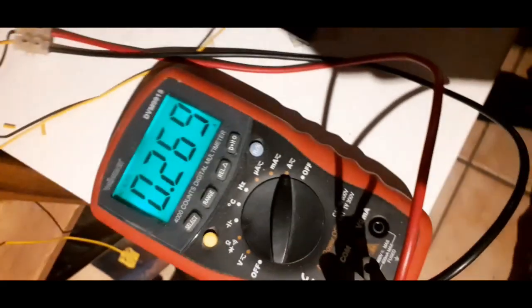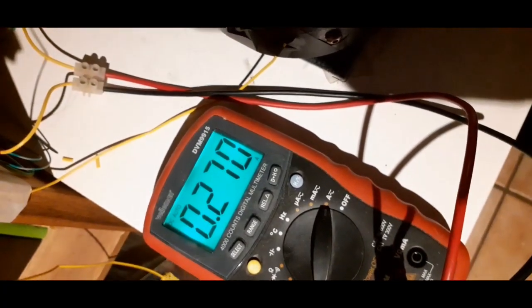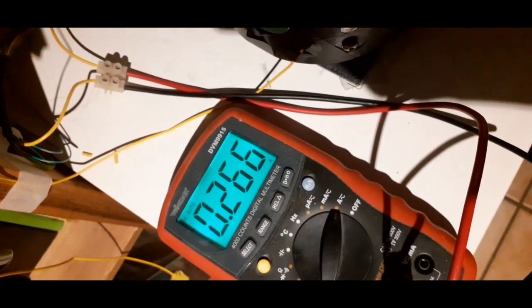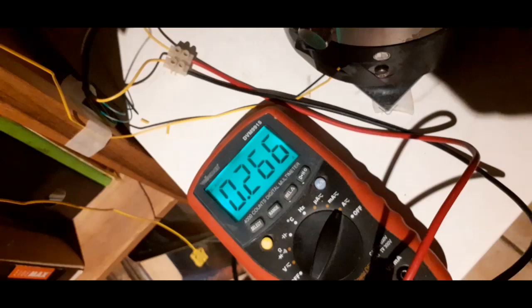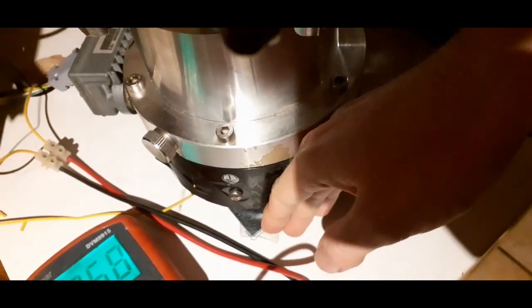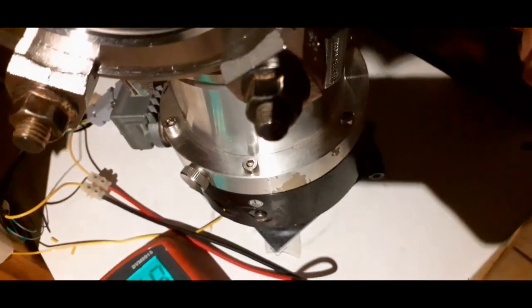And as you can see, the power consumption from the turbo, I've just cut the wire here, is right around 270 milliamps at 80 volts. That's in the late 20s of watts. That's very good, actually. I'm not worried about that either. It's not struggling. This pump definitely isn't struggling. It's a little warm, maybe, I would say, 35 degrees. Unfortunately, I ruined my thermometer, but it's about 35 degrees, I'd say. So yeah, that looks really good.